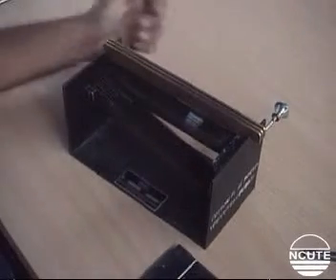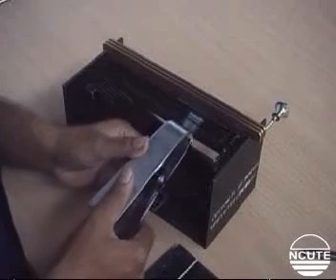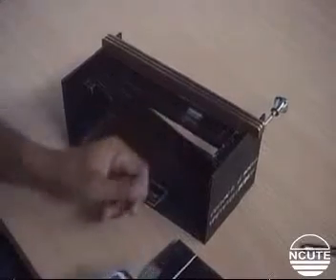Now grip the ends of these fibers, comb and transfer them to the velvet pad as shown, so that the gripped end is flush with the base line and the fibers are close to the vertical line on the pad.